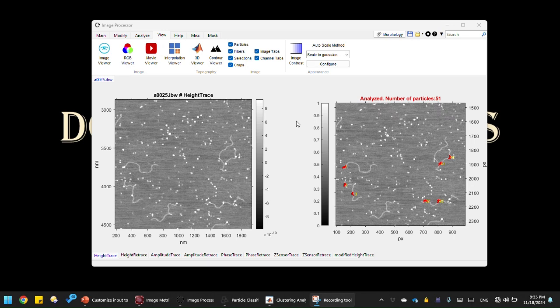In this video, I'm going to talk about issues with using raw data as input to the particle classifier. In this image, which is a huge image of 2 micron by 16 micron size, it is equivalent to 8 2 by 2 micron images. So we can analyze quite a bunch of particles in this huge image.